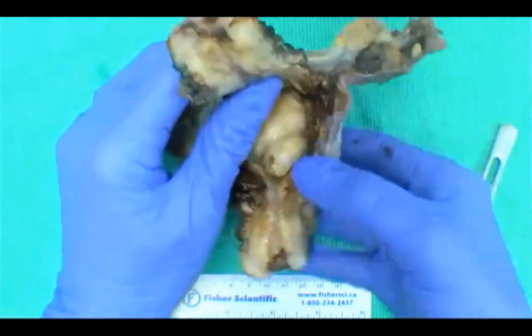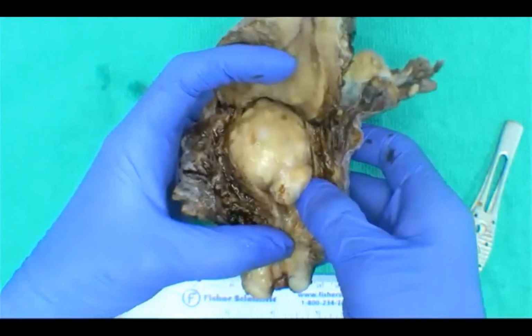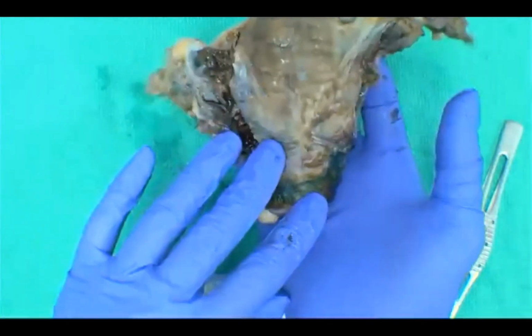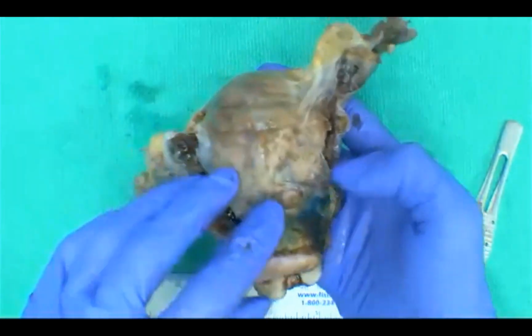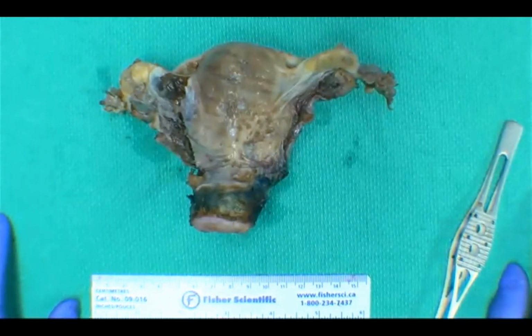Yeah, I guess it could be, but usually you have some more pregnancy-related changes and some more cystic structures. In that case, the uterus would still be postpartum and be rather large compared to this one here. So we're getting some great answers. There could be many benign and malignant reasons why this specimen could have been removed.